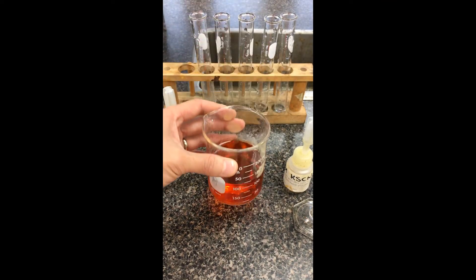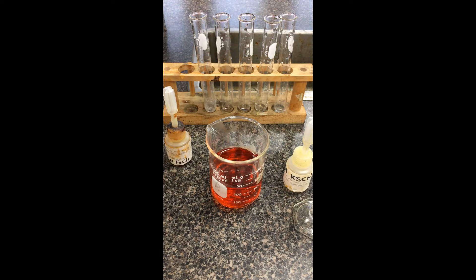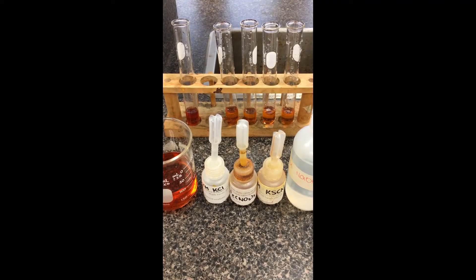I'm going to pour the solution — five milliliters into each of these test tubes here. We're going to keep it constant and then steadily shift the equilibrium. I've taken our standard complex solution and measured out five milliliter portions into these five test tubes.